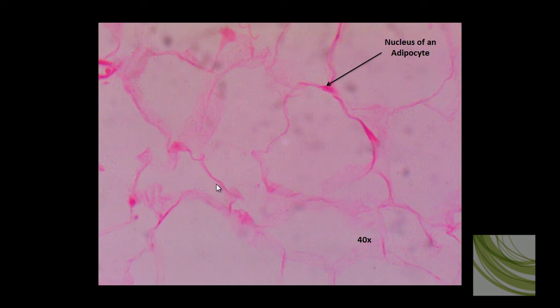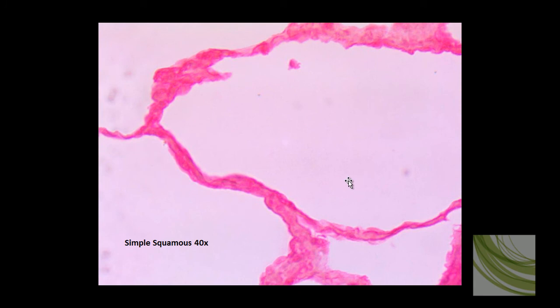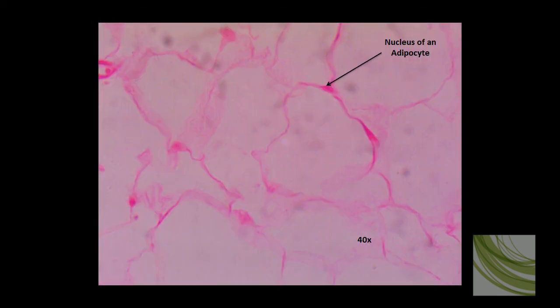And we can compare this to a slide of simple squamous epithelial tissue, which is often confused at the same magnification. But if you look carefully, you can clearly see these irregular individual cells making up the cell walls in this cross-section of lung tissue. So this is something you want to be a little careful of when you're taking a test and trying to compare these two tissues. Look for smooth walls without individual cells and just a few cells scattered as nuclei, basically a big sac full of fatty oils or lipids.